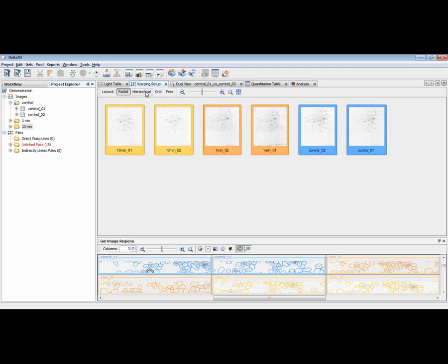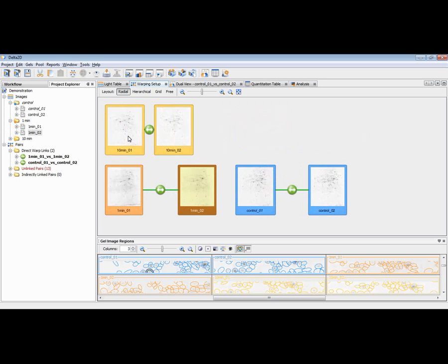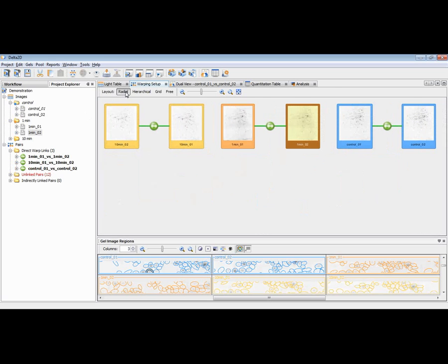Now we want to have a look at the warping setup. And one very flexible and manual way to warp images, or define the way how to warp this experiment, is to just drag and drop the images on top of each other. So I can now just take the second replicate of the 1 minute group and drop it on the first replicate and let Delta 2D know these 2 images should be warped to each other. I can do the same for all the other groups. This is done quickly and rather easily.